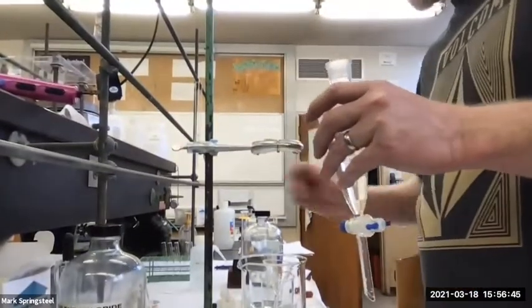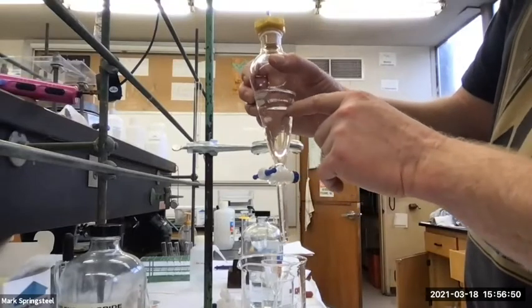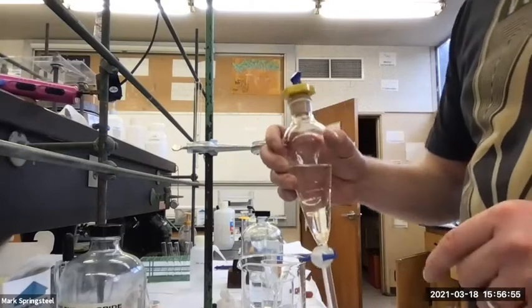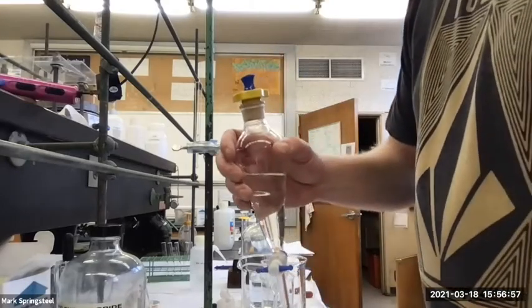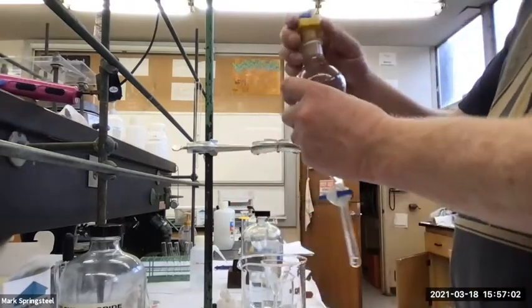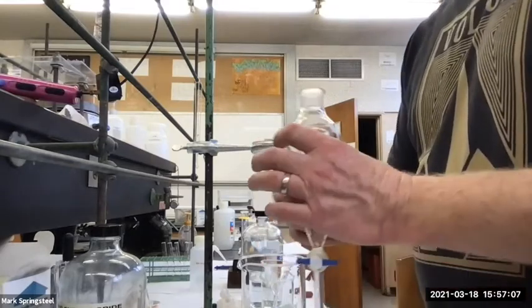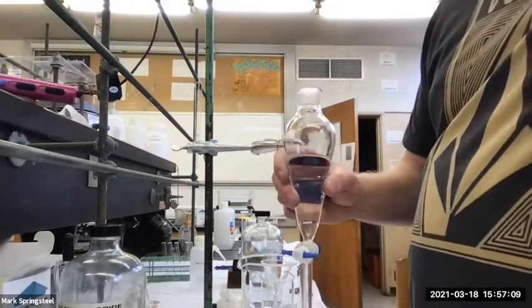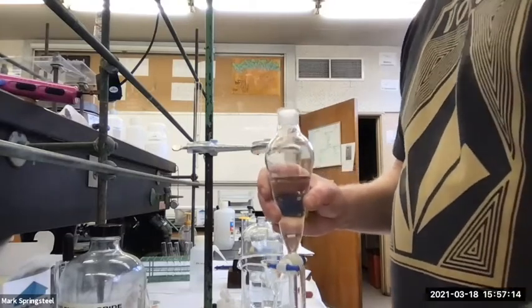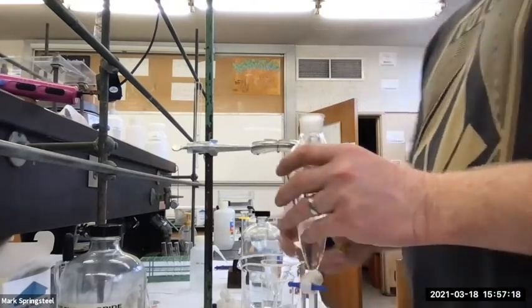But another thing that will help this reaction take place, instead of having to just let it sit here and wait for all of the reaction to take place just at that one interface, what can I do to speed things up? Turn it over and shake it. Agitate it. That's right. Okay, and when we shook the centrifuges before, what did we do? Did we just start shaking it like crazy at the start? Turned it over once and then you vented it. Yeah, we did. We were gentle at first. We vented a lot, and then we gave it a good shake. So I'm going to do the same thing here.